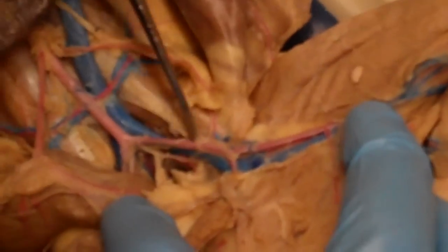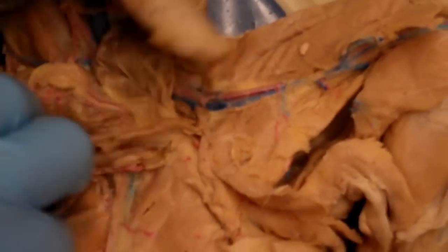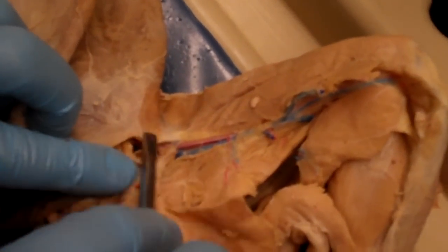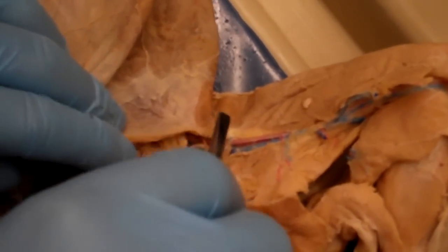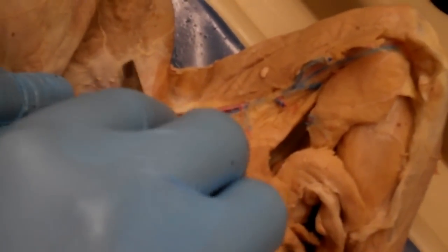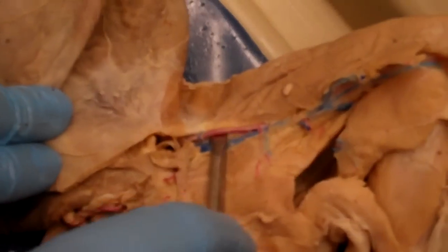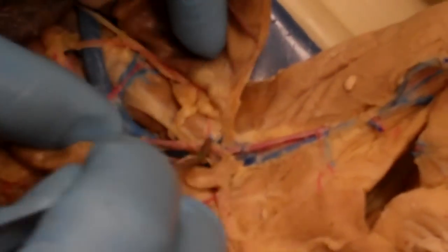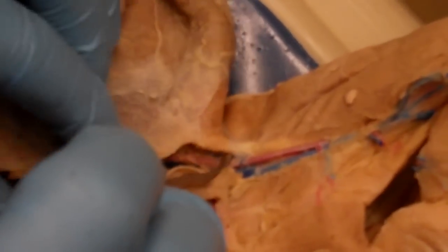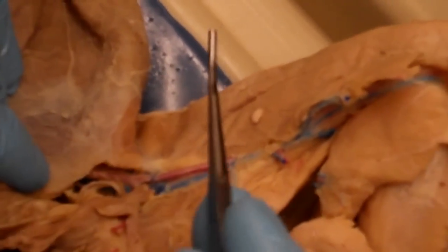The one thing I wanted to show you, because this one has a decent one, is if we follow the external iliac artery, it starts in the body cavity. So if we sort of put back the body wall, it's going to start its life as the external iliac artery. But what'll happen is it'll pass through the body wall, almost like we saw with the inguinal canal. It's a little bit different, but as it passes from inside the body to outside the body onto the leg, it'll just become the femoral artery. So from here to about here, it's going to be the external iliac artery, and from here outward, it's going to be the femoral artery.